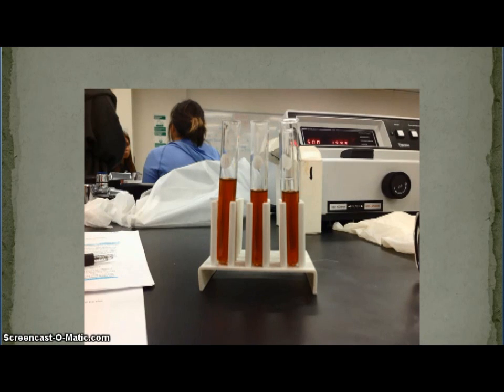Mixing tubes 2 and 3 into a cuvette, we place it into the spectrometer and take a reading every 2 seconds for 2 minutes. We do the same with tubes 4 and 5 after mixing them into a cuvette. We then load the data and choose the amount of extract to use in the rest of the experiment.